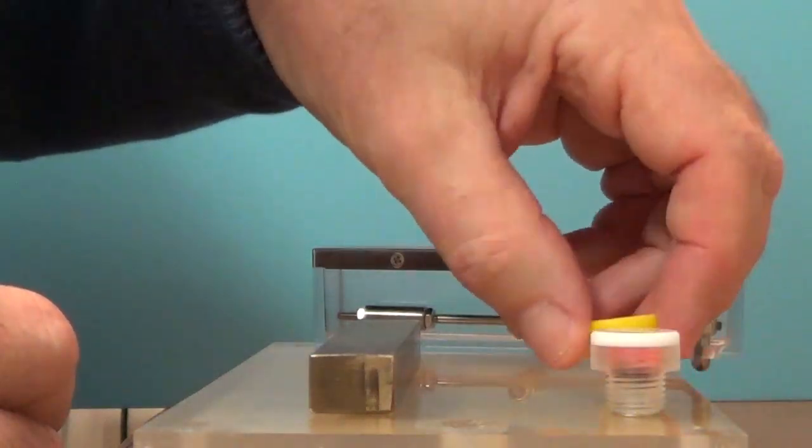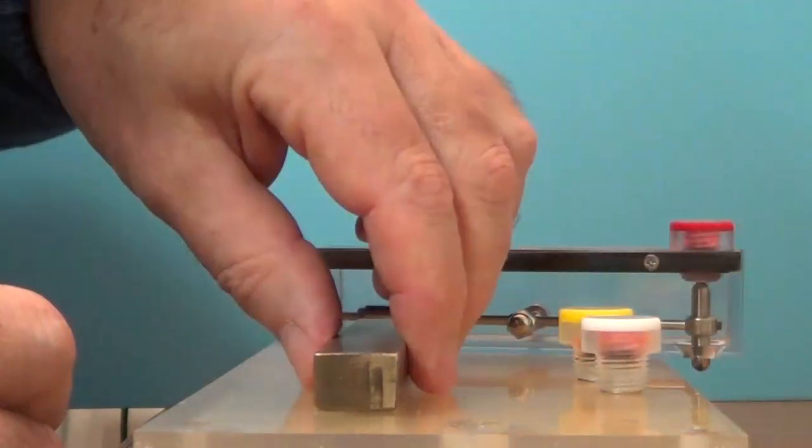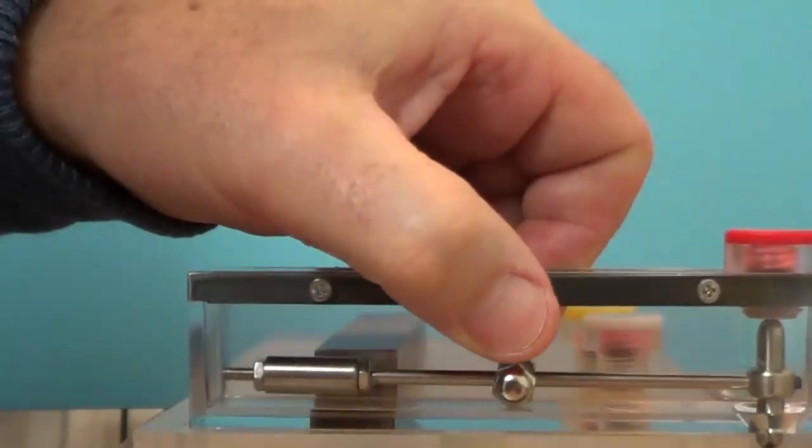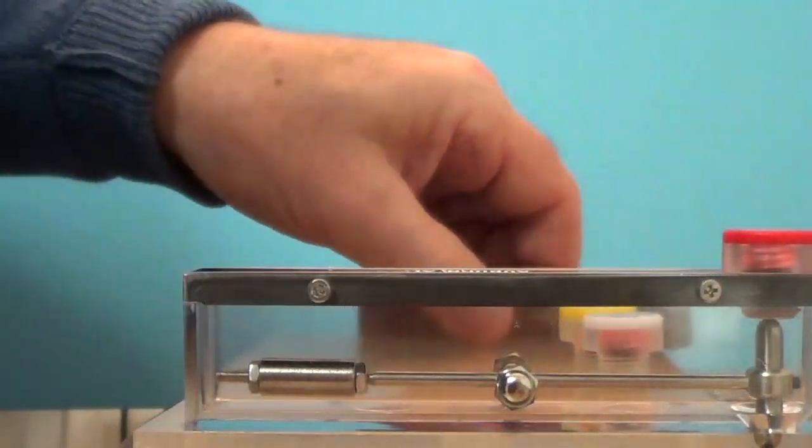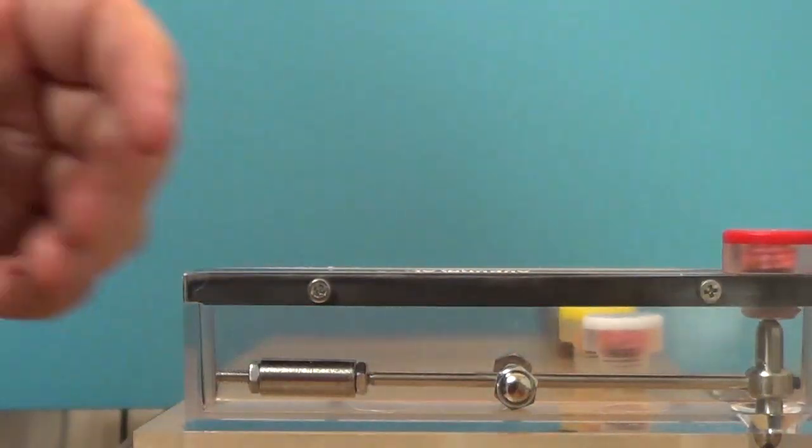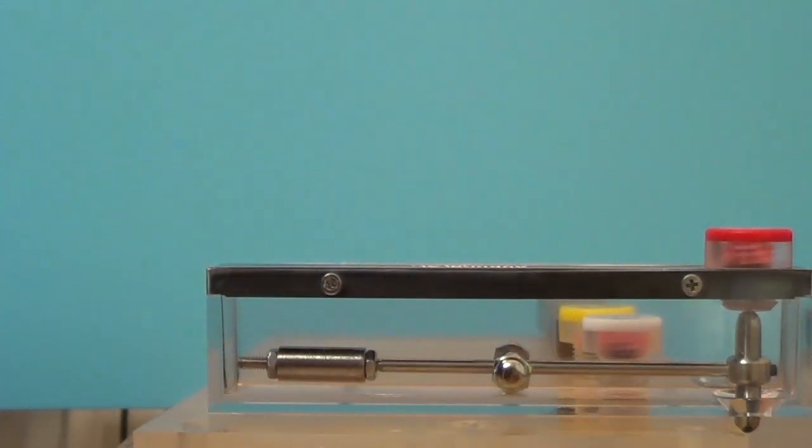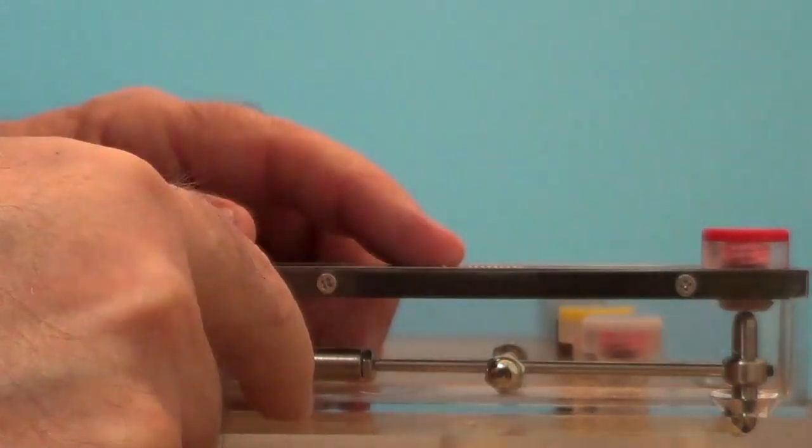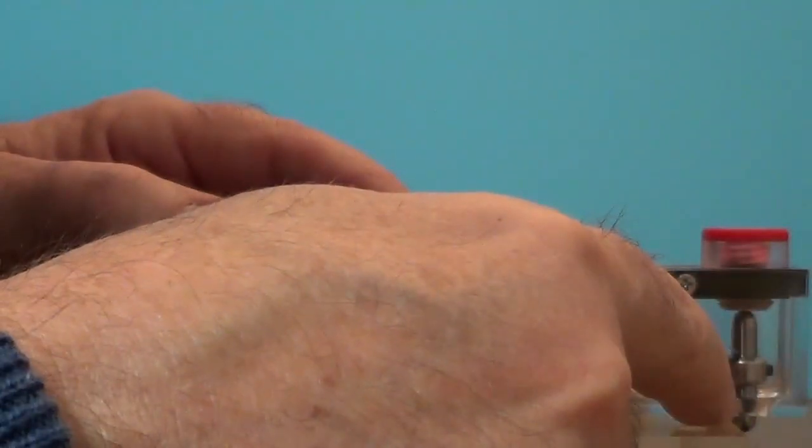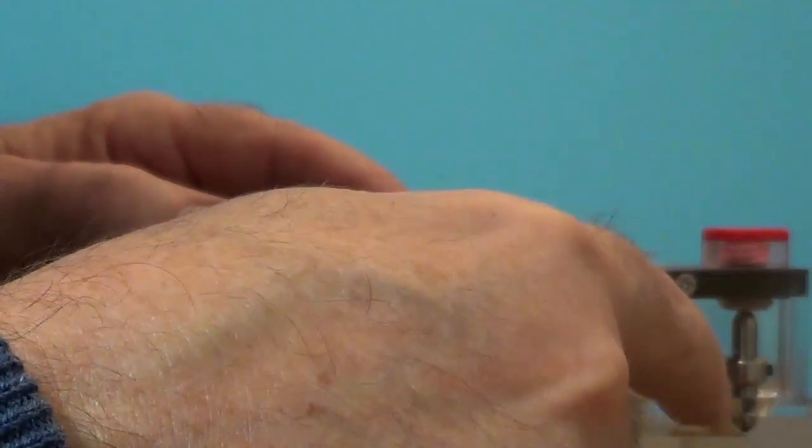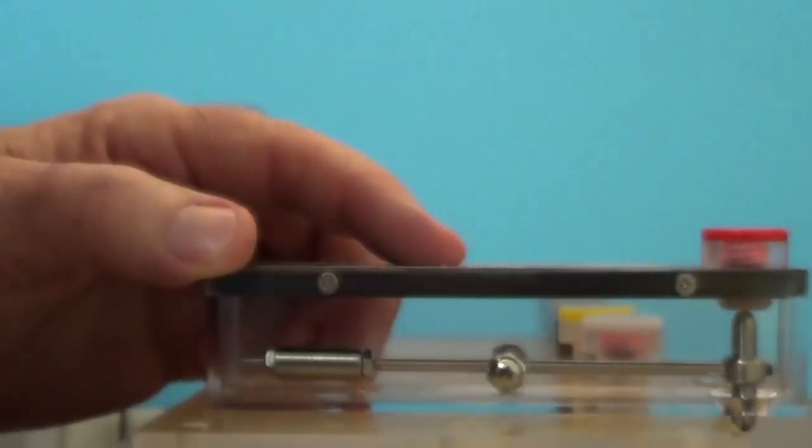Let me talk about the instrument in just a second. If I move it out front and center, what you're going to see is the instrument itself is very simple. It is simply a balance beam made out of non-magnetic material. But it does have a bar magnet fixed at the right end here vertically inside the collar of this beam.